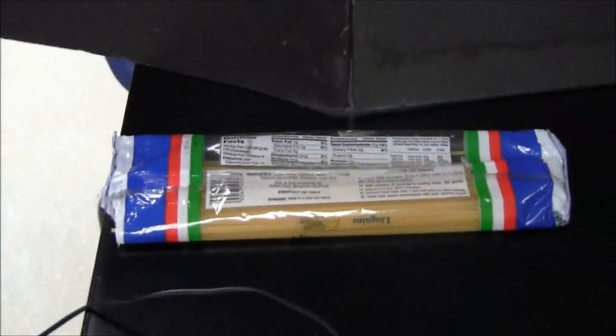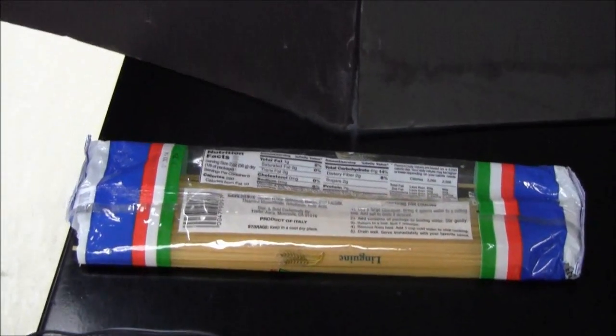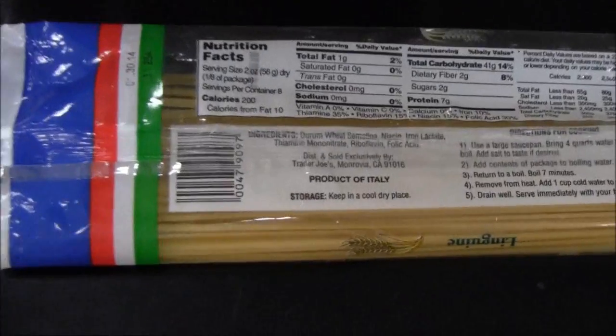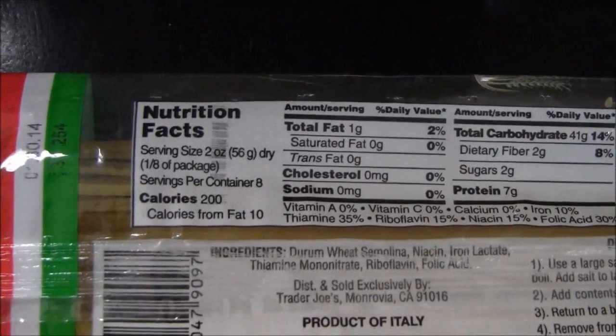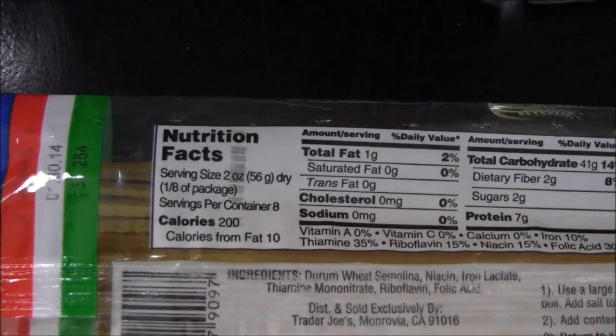Hi, so this is the first part of the human biochemistry unit which is working out how many calories are in food. We're going to use joules and kilojoules because it's the 21st century. So the food that I've chosen to use is pasta. Normally I'd burn peanuts to try and work out how much energy is in it, but peanut fumes can cause people to have nasty reactions. There's the data for the pasta, and we'll see if our data comes anywhere close to that.